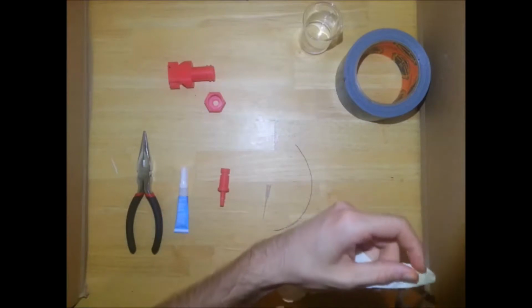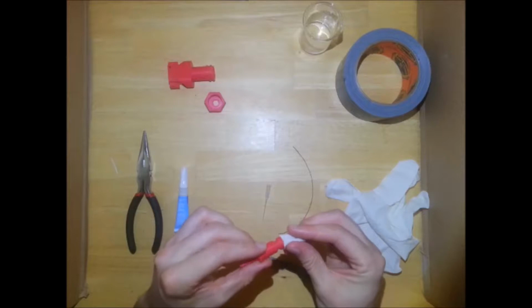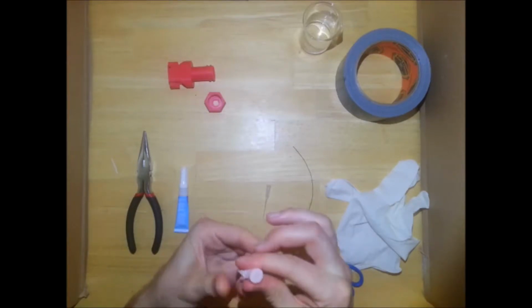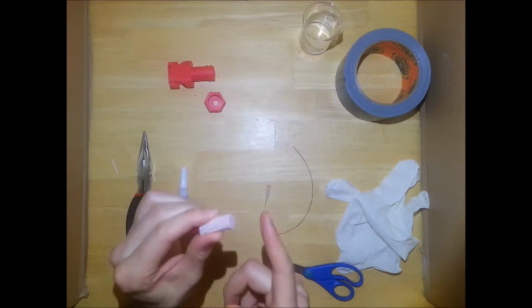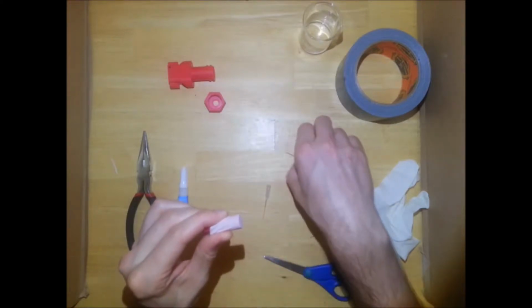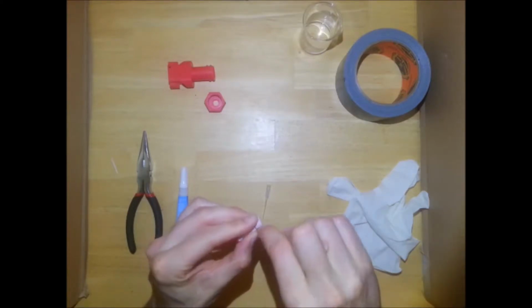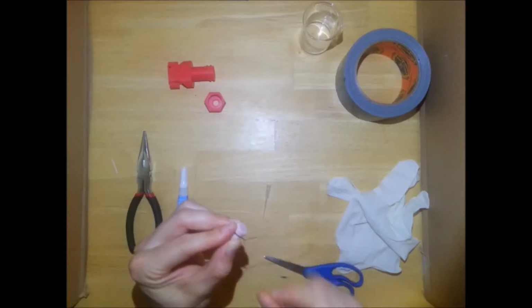Once you've done that, you can go ahead and take the tips of gloves and place them over the top. You want to stretch the glove over the top of the part such that this is nice and tight. And then wrap a piece of wire around it, which will fit inside the groove of the part.